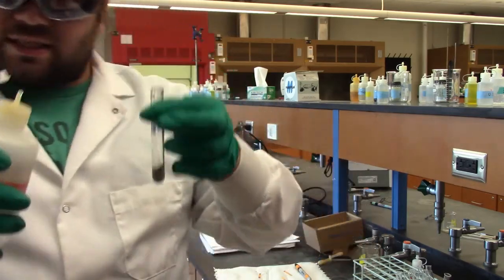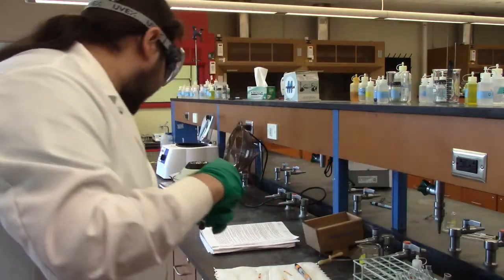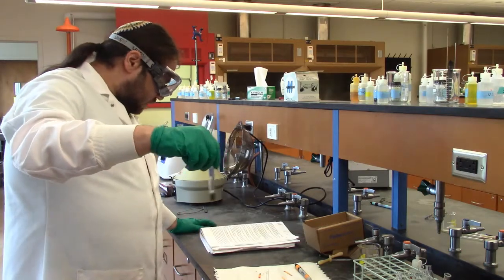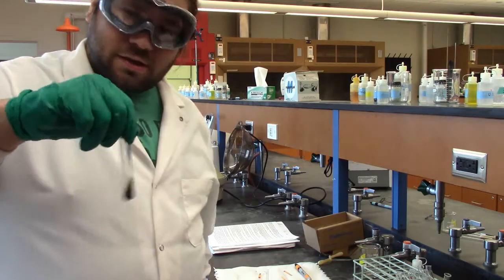I don't know, we'll say that's 10. 10, that's close. Give or take. Yep. It's concentrated acid. At this point, it's acid in there. Yeah. So yeah, give it a good stir, and once again, we'll heat for 5 minutes. So, see you momentarily.